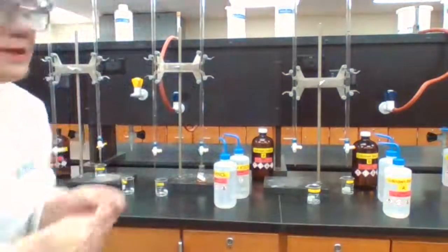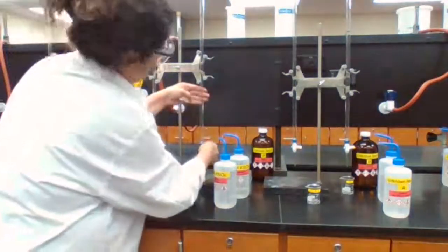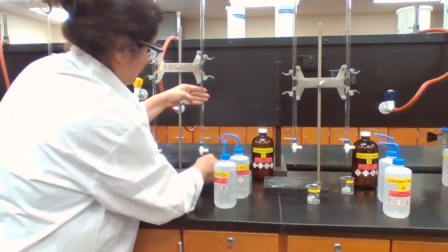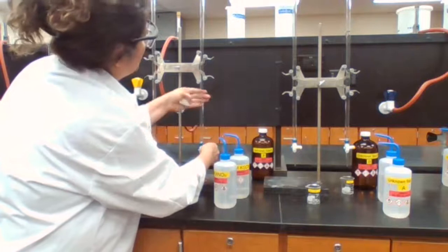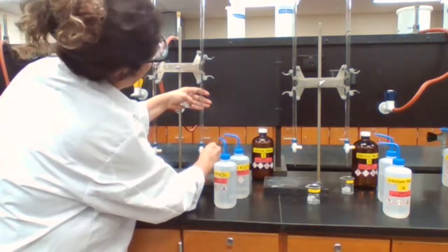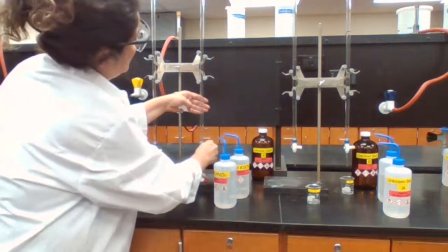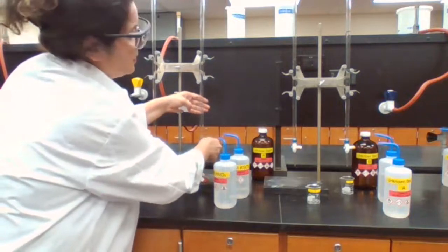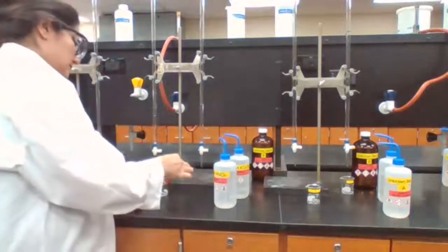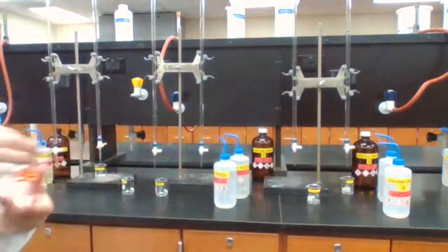We look at the time, it's 2:10. 35 to 40. Okay.